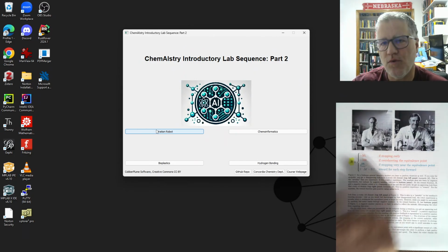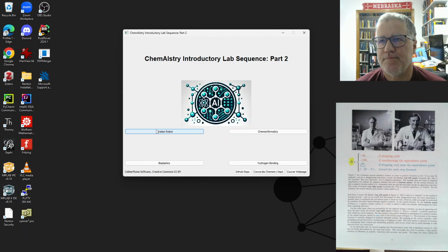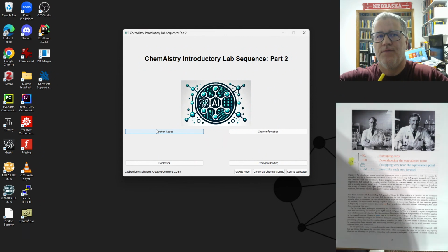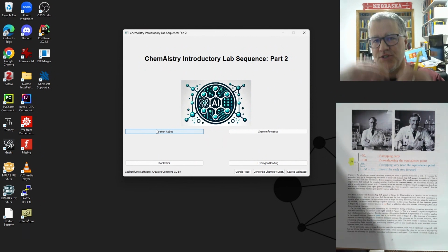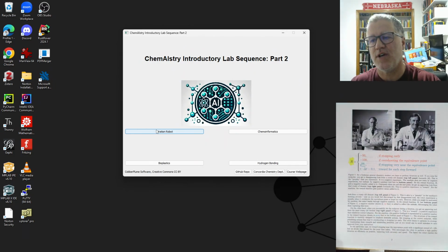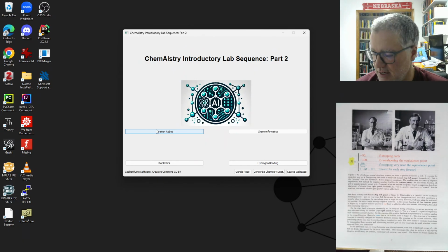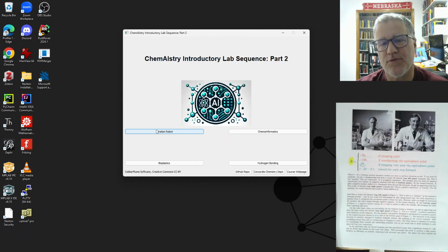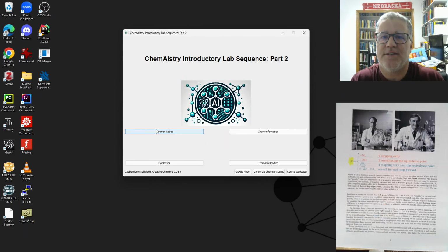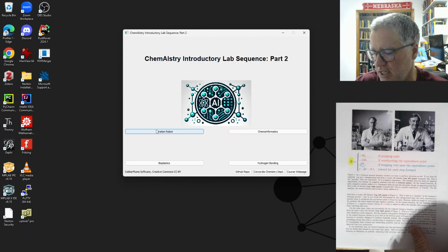And then we also want, partly to get the algorithm going, because the robot doesn't know what it's supposed to do, so it's just trying to learn at first, to give a little reward whenever it steps in the right direction. So when it starts to add titrant, we want to get some reward. So to get it going, we want to add titrant. So there's a piece of the reward function that gives it some points for just moving forward in its titration, because it wouldn't know to do that, and that all needs to be built into the reward function.